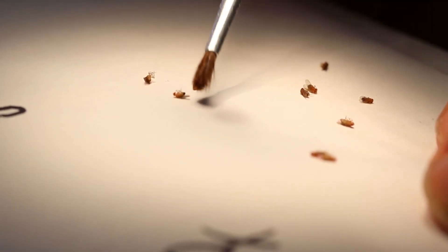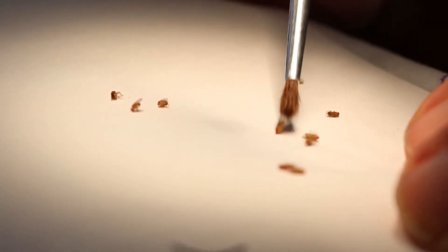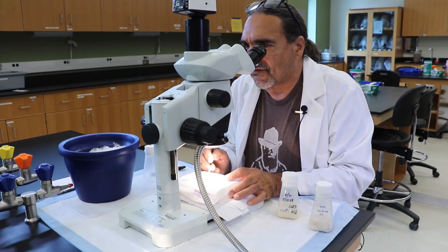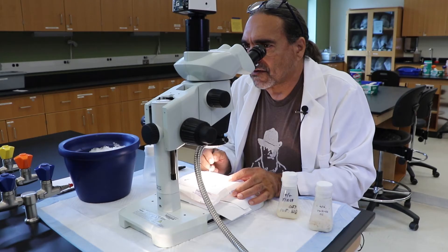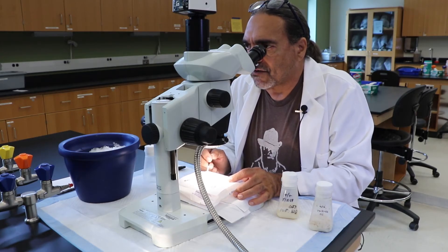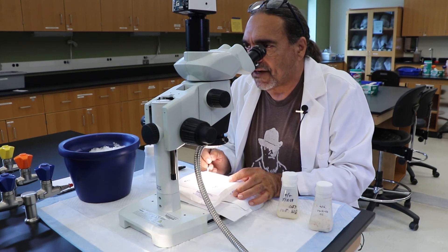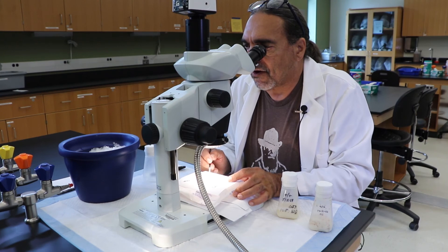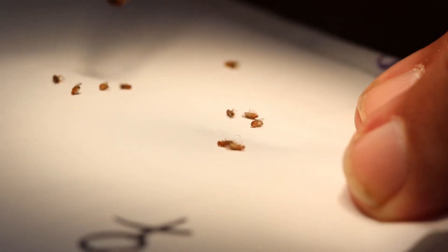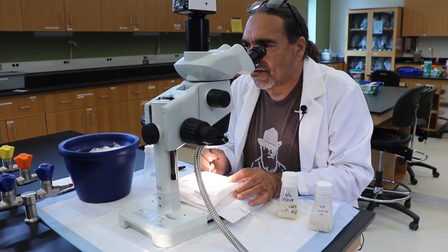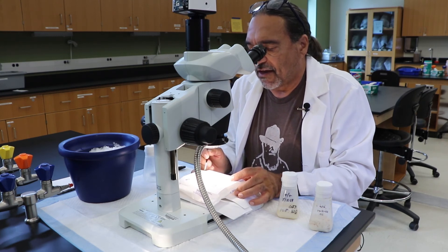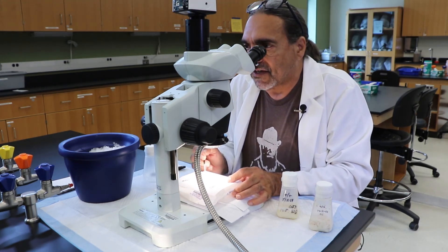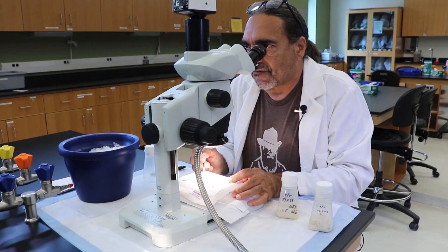You can identify the males very quickly because they are smaller than females. Remember that sexual dimorphism in flies is such that females are always larger than males. You are also able to identify the males because the bottom portion of their abdomen is very dark black and females are very light. Notice that the flies are still asleep. They haven't begun to wake yet. I now have them separated into males and females, and I'm just going to count 10 of each type so that we can transfer them into the vials.